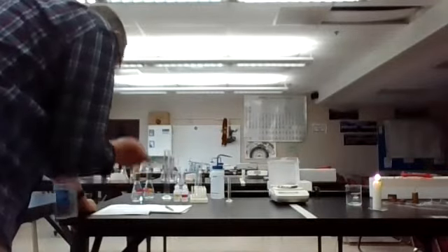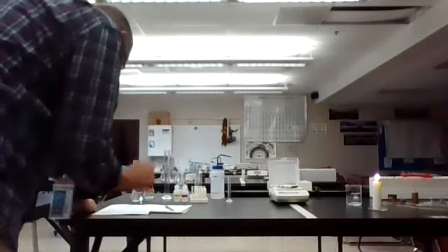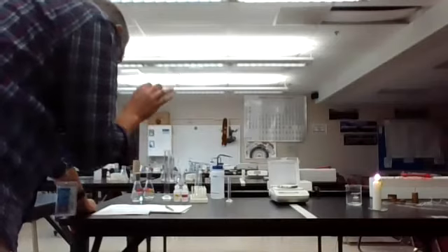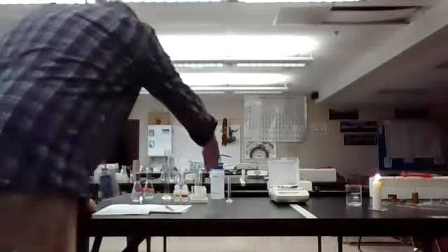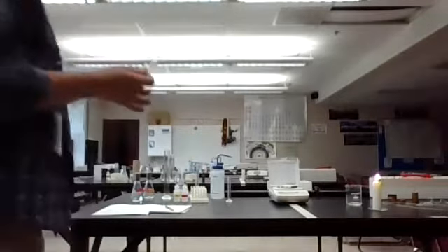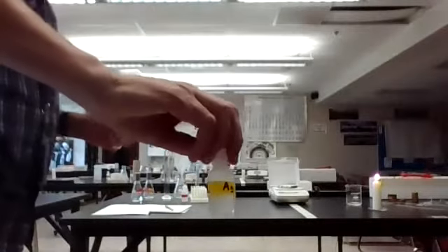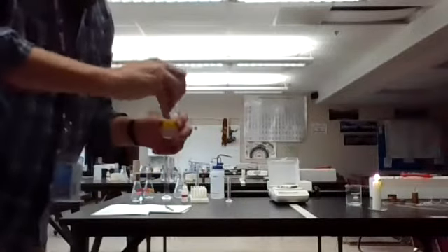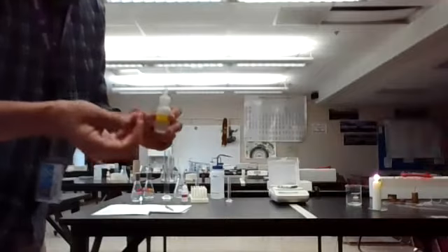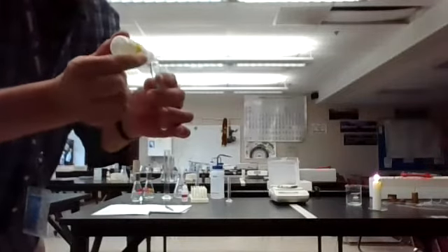Okay, number 4, we are going to mix silver nitrate with some hydrochloric acid and see what happens there. So I have a second test tube. Instead of using a pipette for this part, I'm just going to use these dropper bottles we have. So here is my silver. This is a 0.1 molar silver nitrate solution. Cap like this on your little dropper, you don't want to set the cap down. All I'm going to do is count the 20 drops from here.